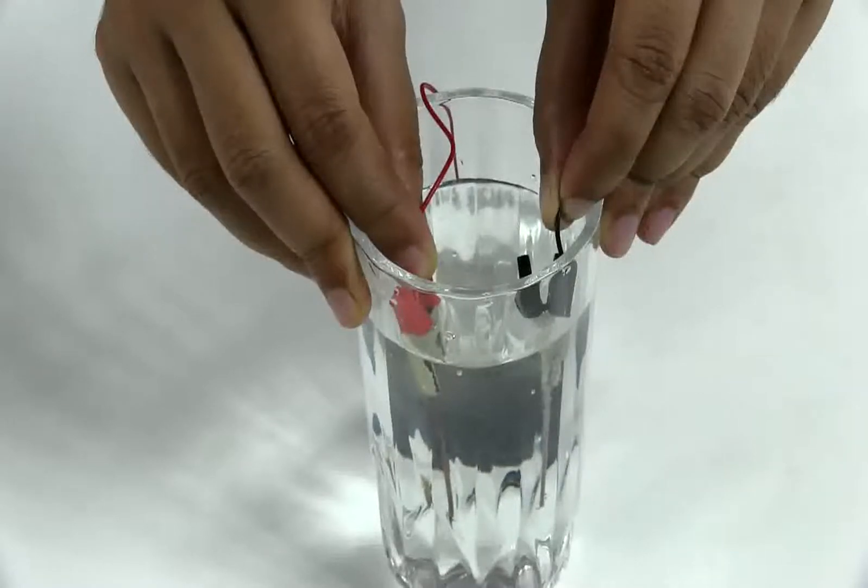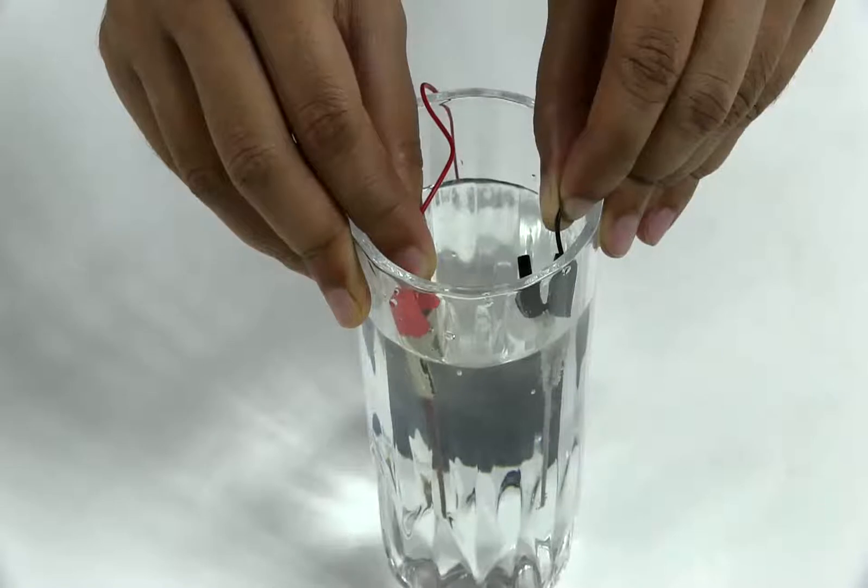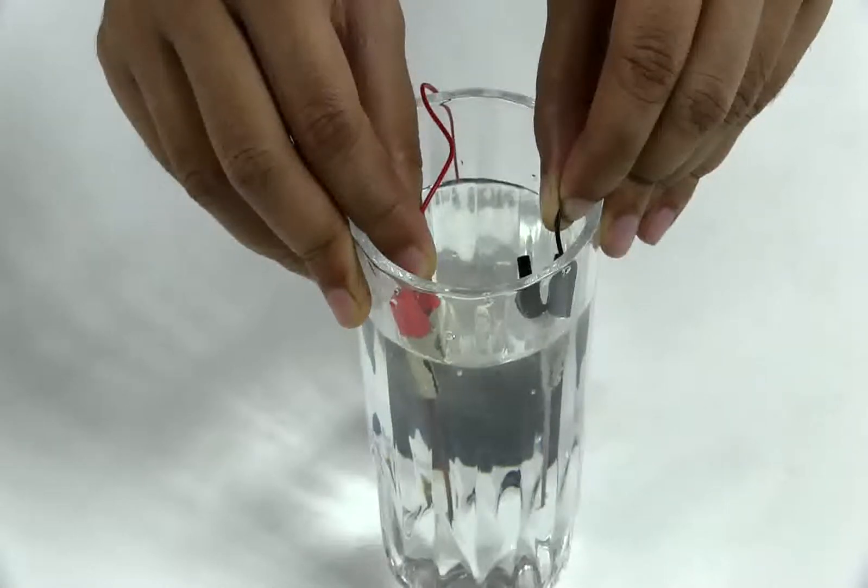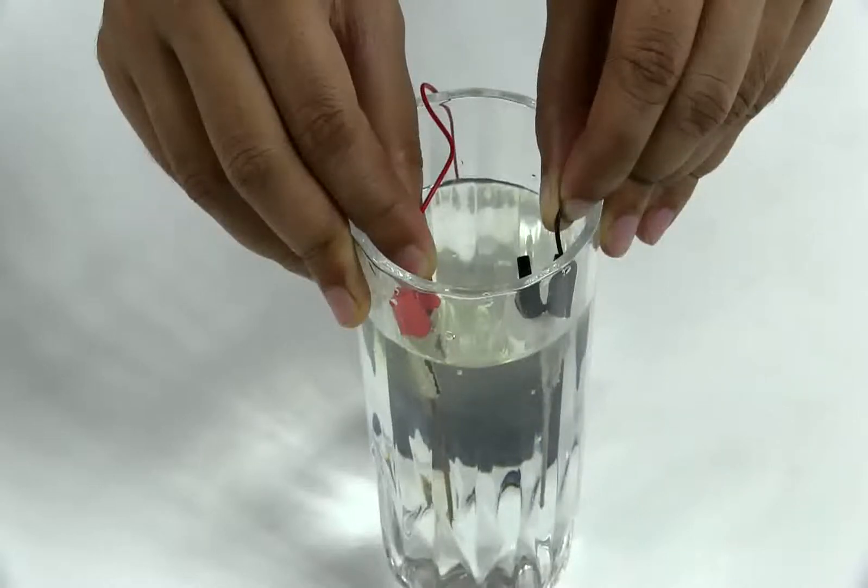Or the copper itself to make copper chloride. If we leave this glass like this for a few minutes, we can see the difference very clearly.